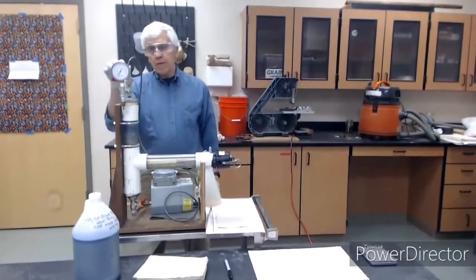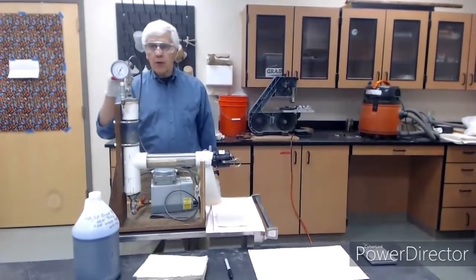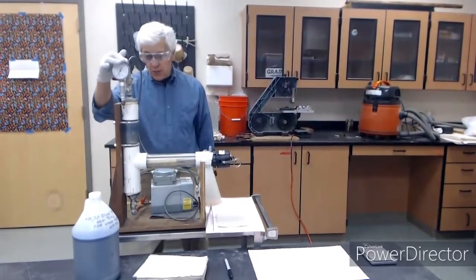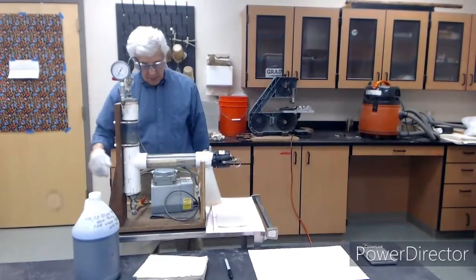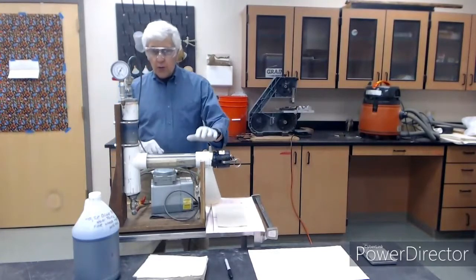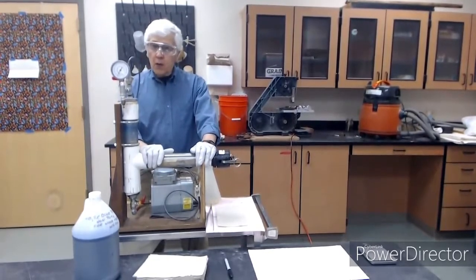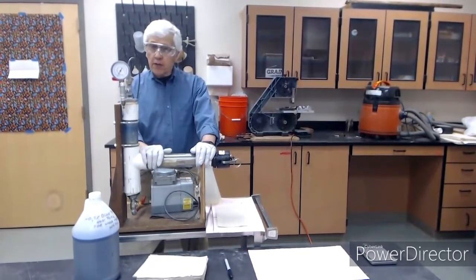So when we open this valve, we'll be pulling a vacuum. Right? Here's a gauge that measures both vacuum and pressure. So that's how we will track what's going on. So we'll fill the cylinder, and we're going to wait 5 minutes. We're going to pull a vacuum for 5 minutes. Then we're going to fill the cylinder while we hold the vacuum. Then we will break the vacuum.